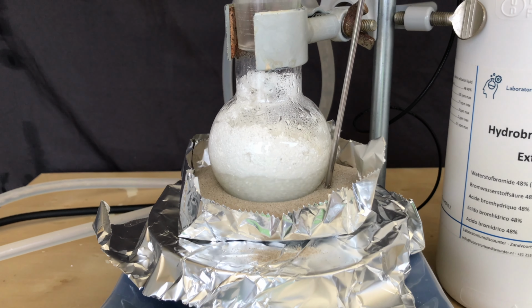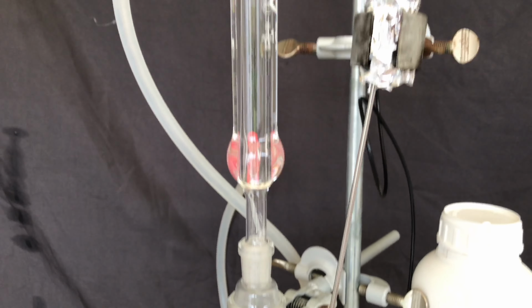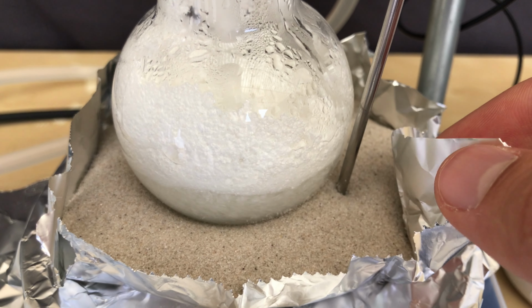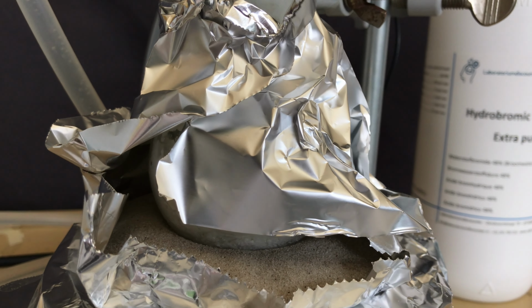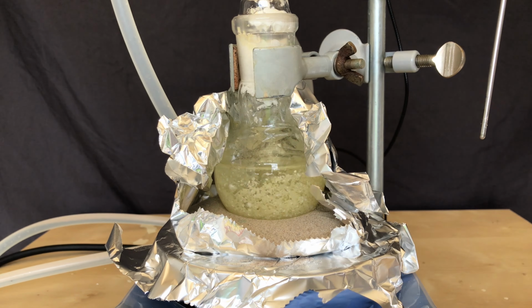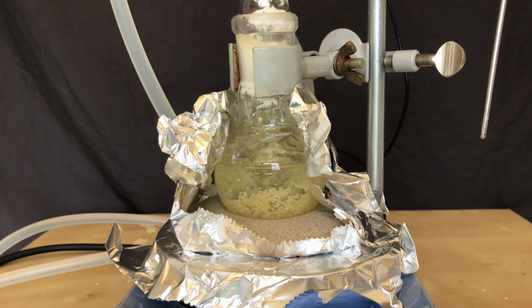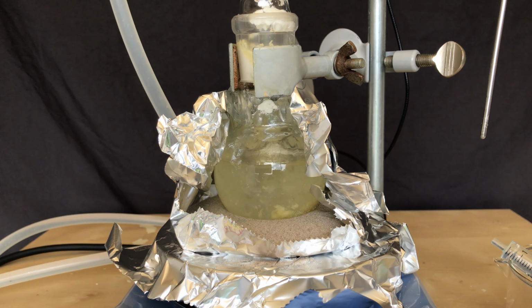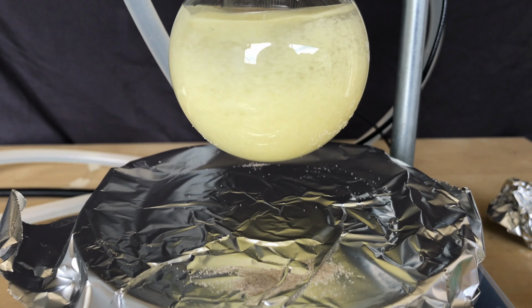Even though this was not the original plan, I set up a reflux and started the reflux in hope that anything would happen. I also noticed that there were sparks between the aluminium foil and the thermocouple, which was bad. I refluxed for about 2 hours, yet nothing dissolved. It even looked like lumps were floating around in the round bottom flask, which would not be good.